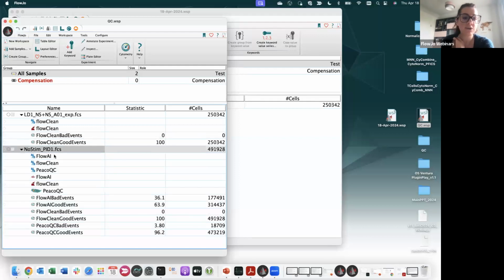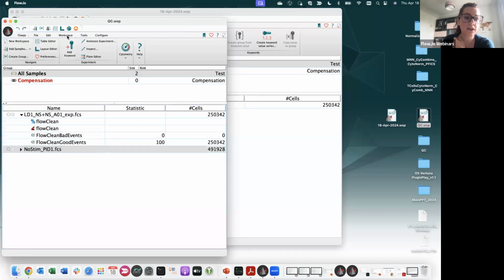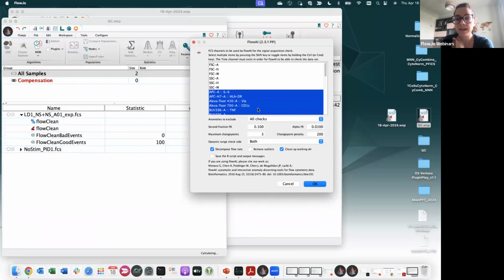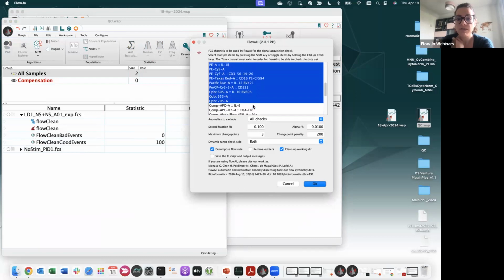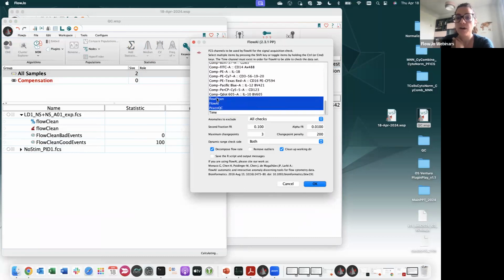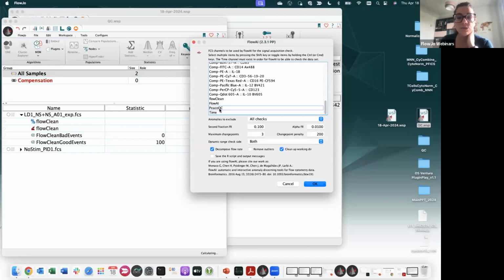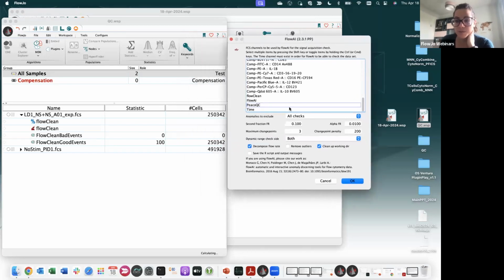But when I ran FlowAI, and I will show you how to run FlowAI, okay, so you go again under Workspace, Plugins, FlowAI. If you have run another plugin already, what you will find is an automatic selection of the derived parameters from that. But you should remove this, okay? So if you have something like FlowClean, FlowAI, and PeacoQC, because you already ran these algorithms on this workspace, you will find them in the list, but you have to remove them.